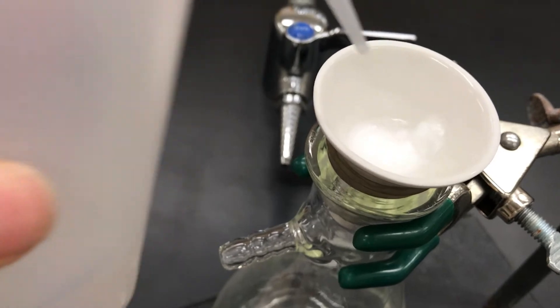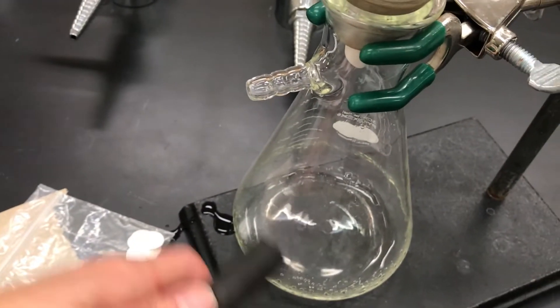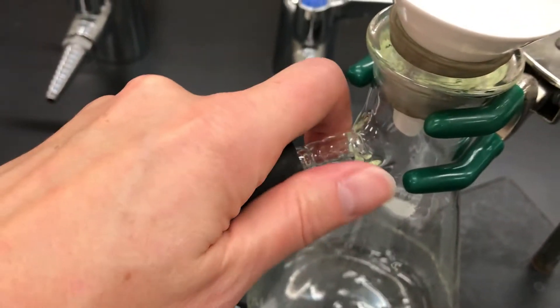So this will try to remove the mother liquor from the solid if you did a crystallization.